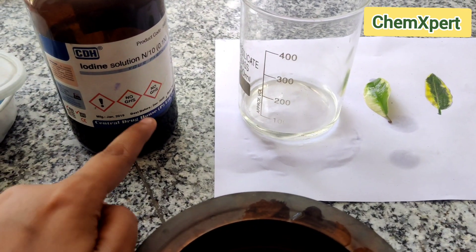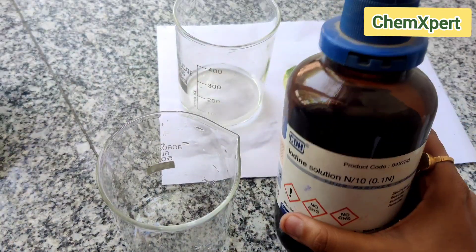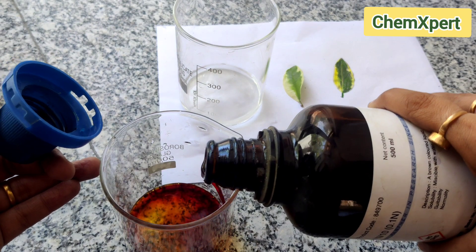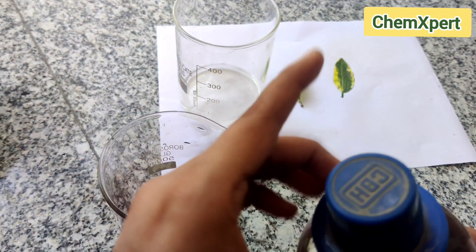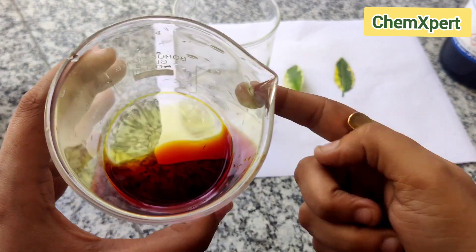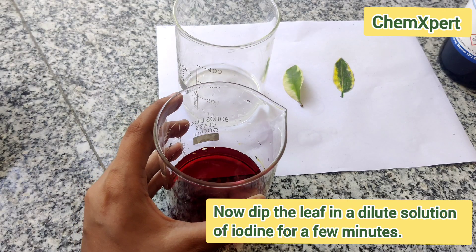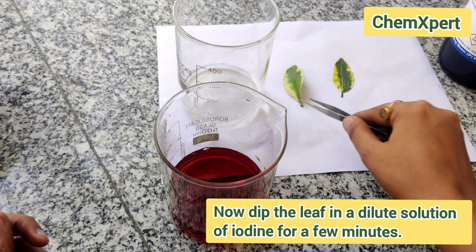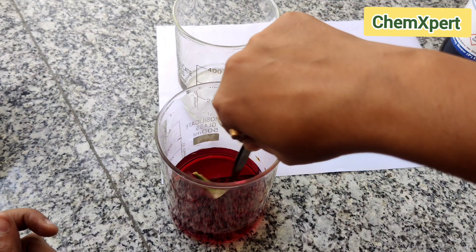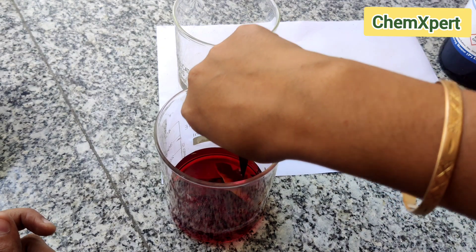The next step is to dip the leaf in a very dilute iodine solution. I am taking iodine in a beaker and adding water to dilute it. Then I place the leaf in this iodine solution for a few minutes.